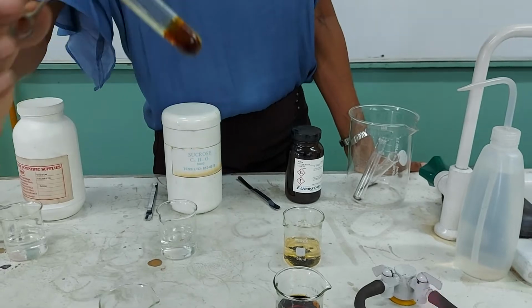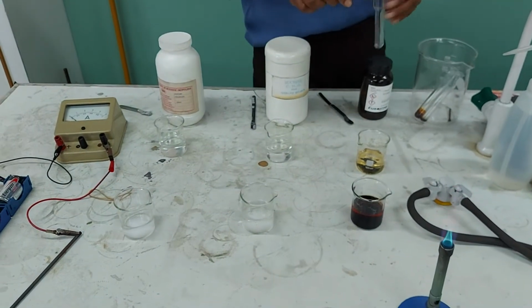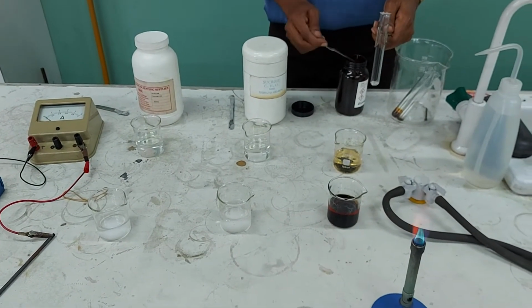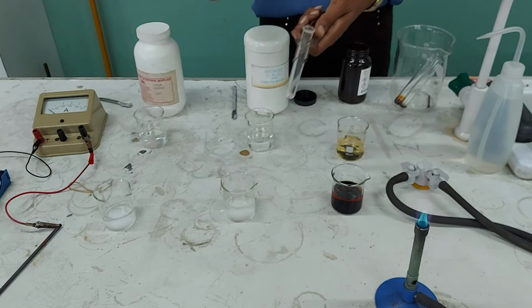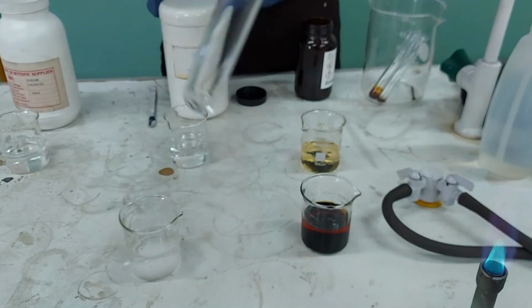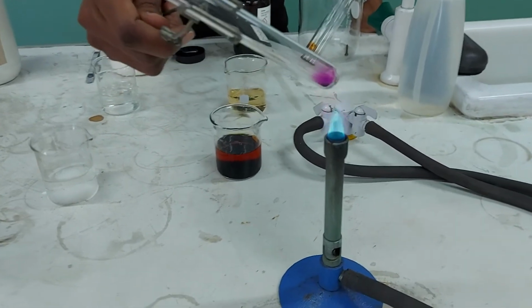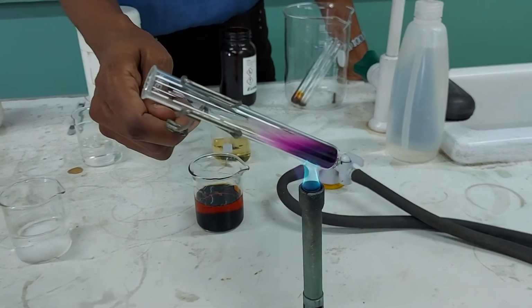I'm going to move on right now to the last substance for us to deal with, which is going to be iodine. So I'm going to take a little bit of this iodine solid, not a lot, and put it inside my test tube. You will see that I'm just putting a little bit of iodine inside it there. It really is not a lot, but from the small amount of particles in there, I expect a big change. So I'm going to heat it. It went in as a solid. Please note all the observations. And I'm going to heat it a little more strongly.